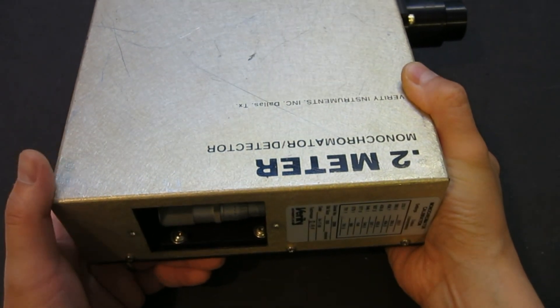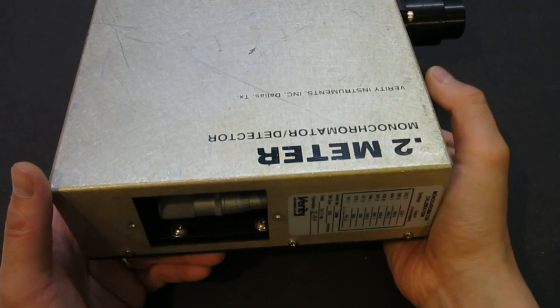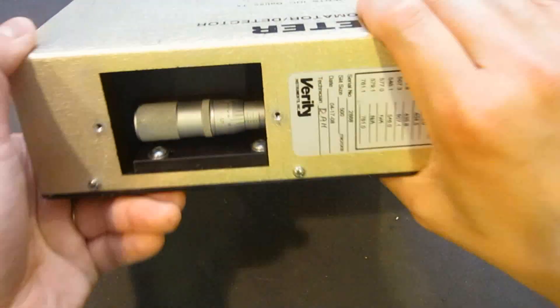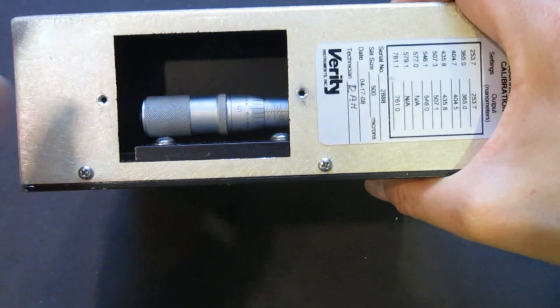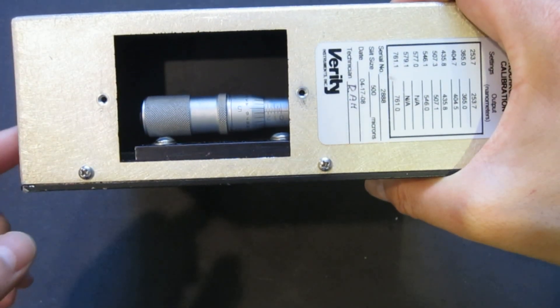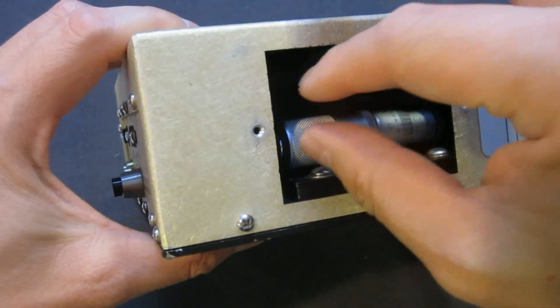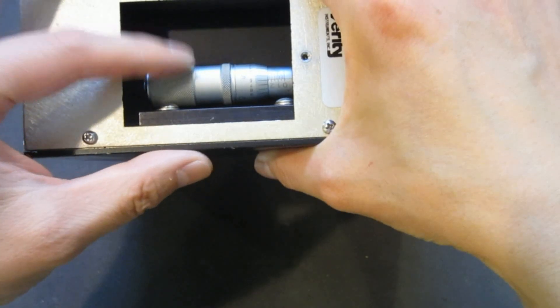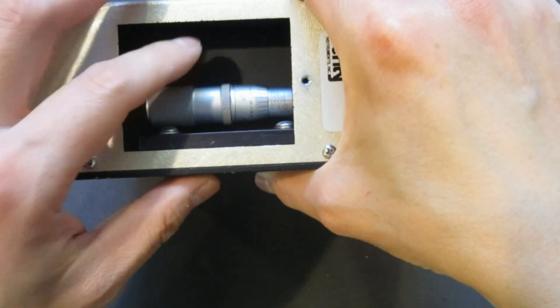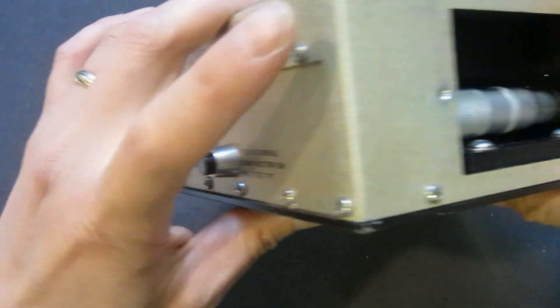So I thought I would make it somewhat automatic as well. But I don't have the tools — as you saw on the Signal Path where he actually made a custom hub and put it on top of this screw micrometer, and also made a cutout and installed a nice stepper motor.